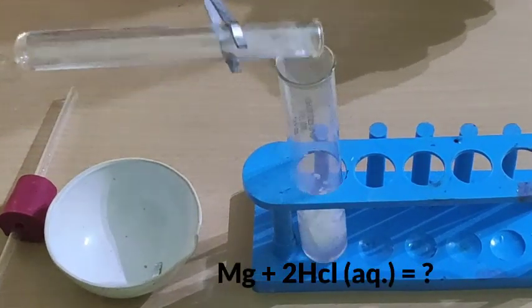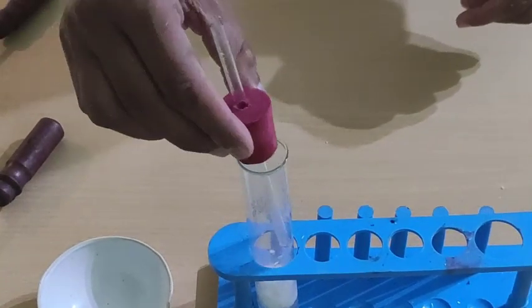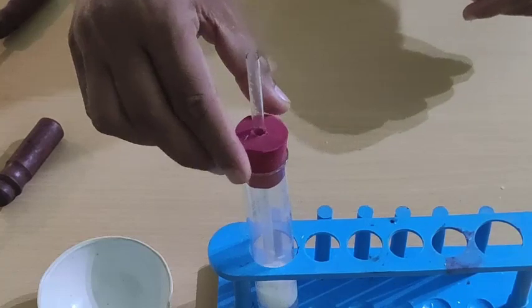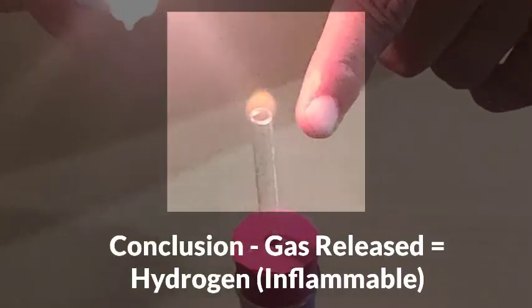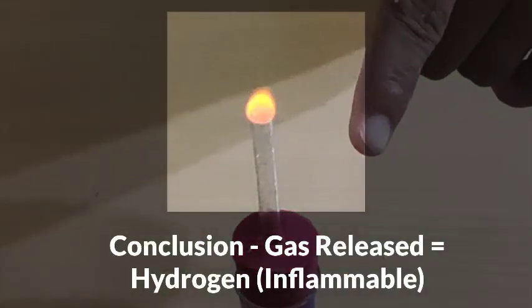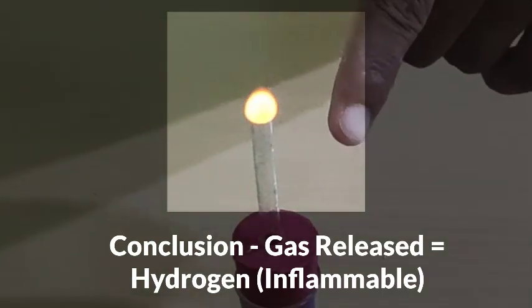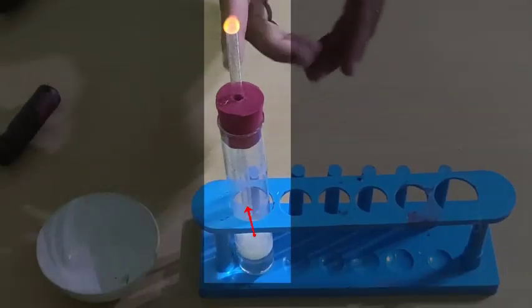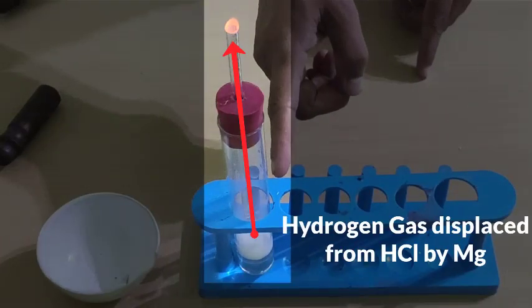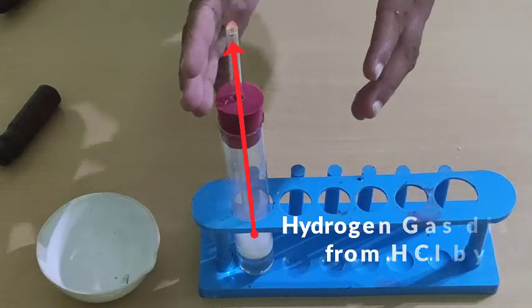and the same way the bubbles are getting formed, and I'll close the mouth of this, and I'll bring a lighted candle. See, it's burning. That means the gas which comes out here is inflammable, and that is hydrogen gas. That means what happened here in this test tube, see, bubbles are getting formed, that means hydrogen gas is coming out. Now what reaction happened here?